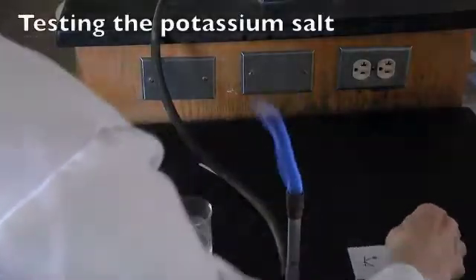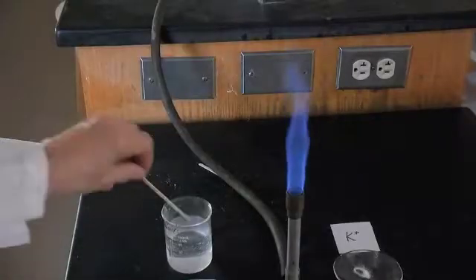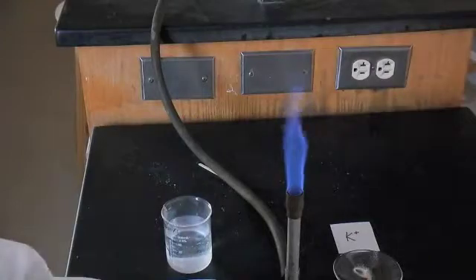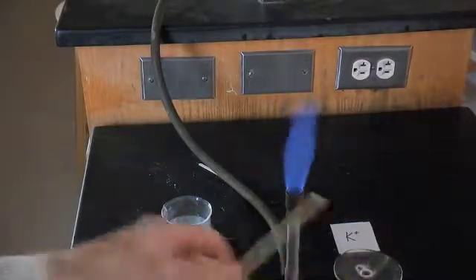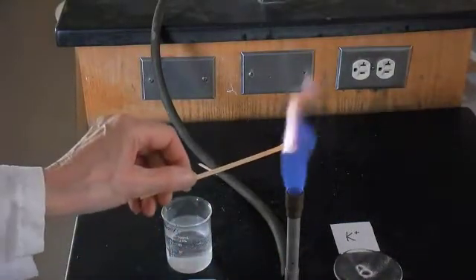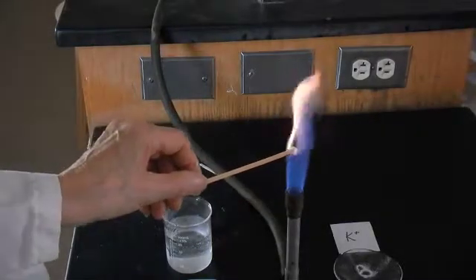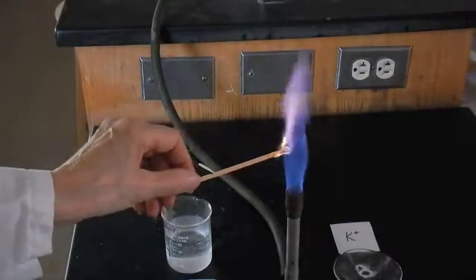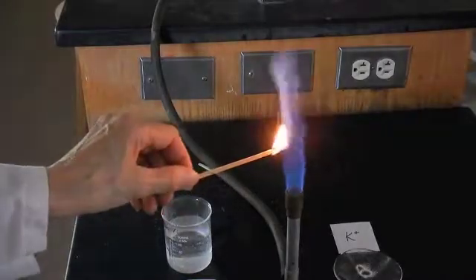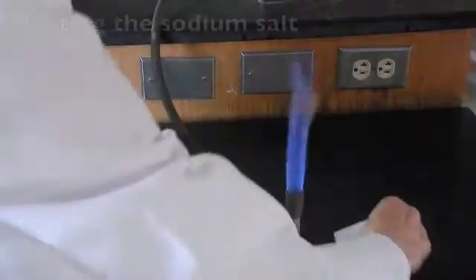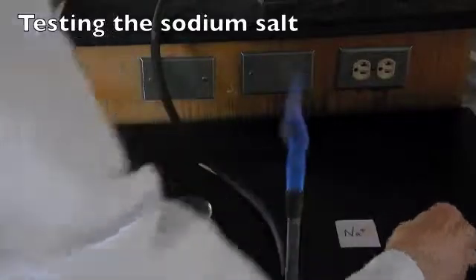Then going on to potassium. Here you can see just dabbing the moist taper. Look closely at that color, very closely—some parts of it are clearer to see than others—and then it goes into the taper burning color. And then sodium.